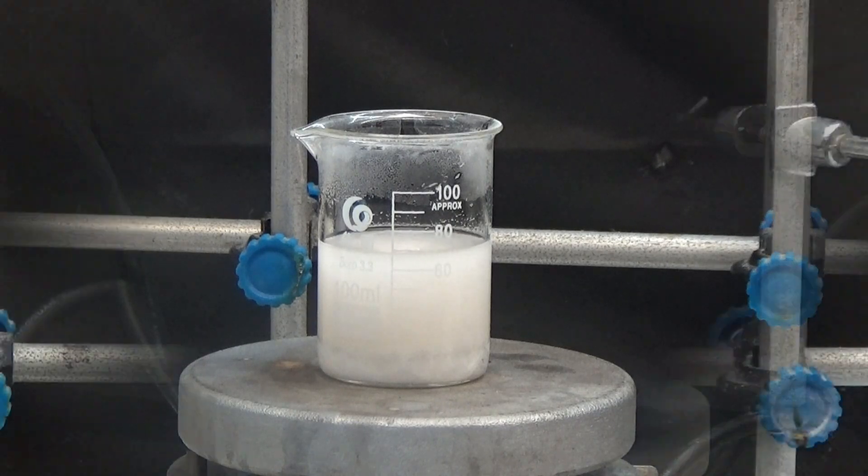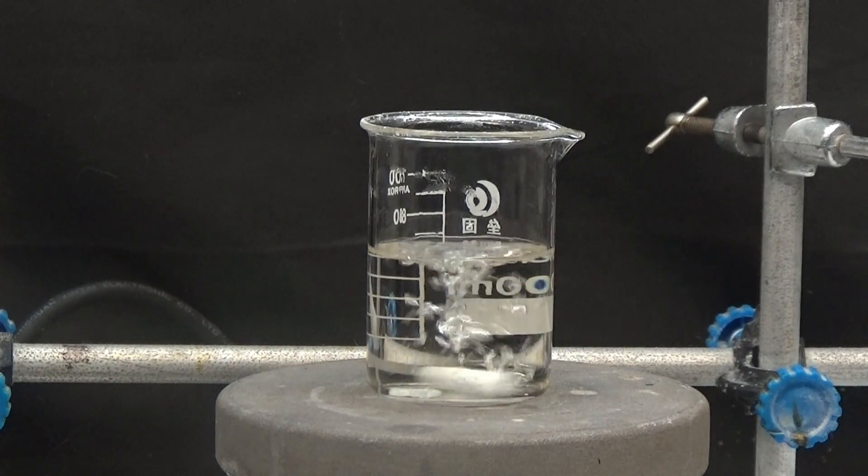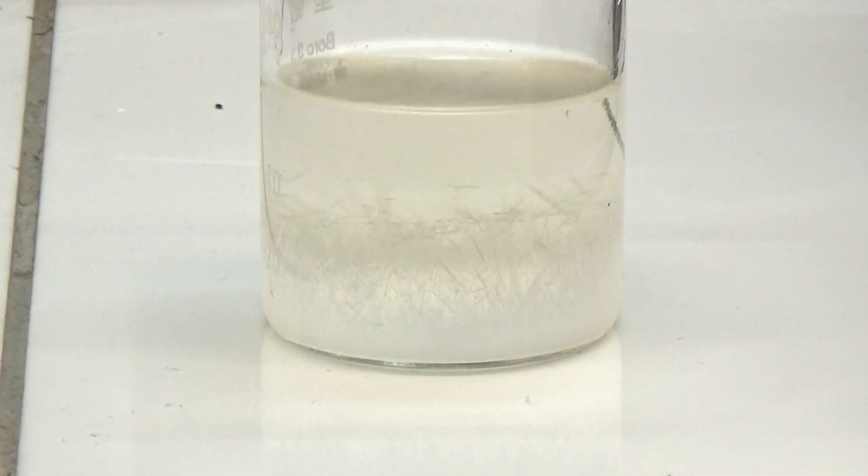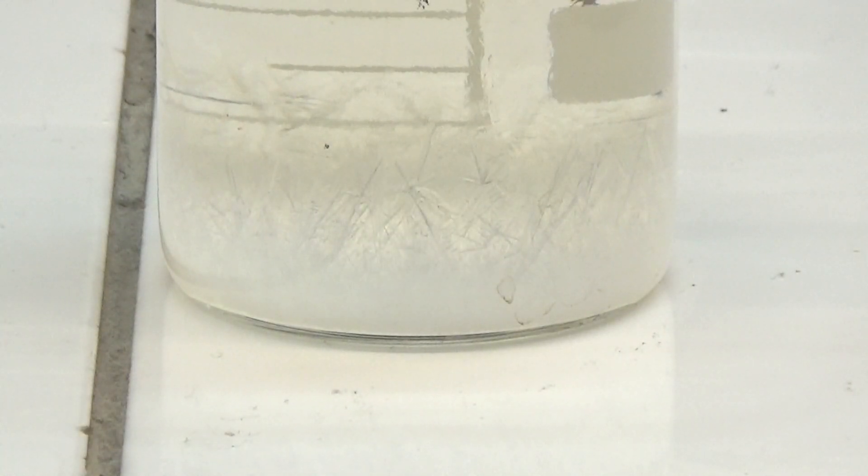Re-crystallize from hot acetic acid and allow to cool. White needle-shaped crystals are obtained. Use a suction device to collect and wash with 30 milliliters of ether.